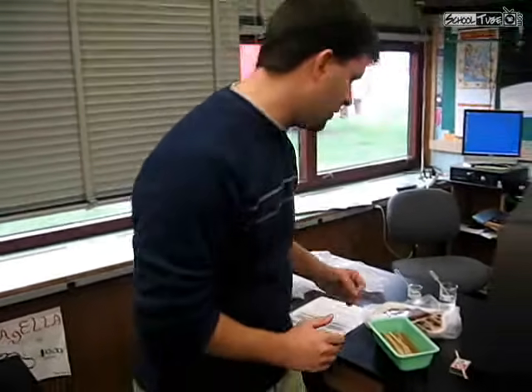Catalase is made by every cell in your body. And when it breaks down peroxide, it turns it into water and oxygen. So what we're going to do is systematically prove that the liver, which contains the enzymes, is going to break down the peroxide into both water and oxygen. So we're going to start with test tube number 1. It's going to be our control.